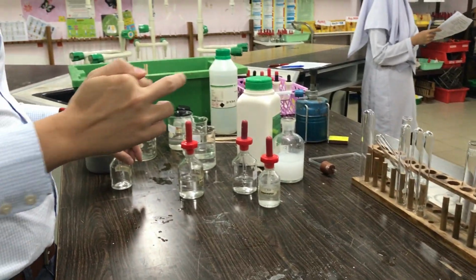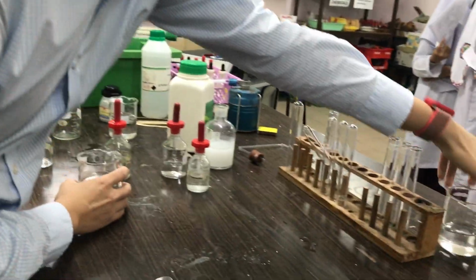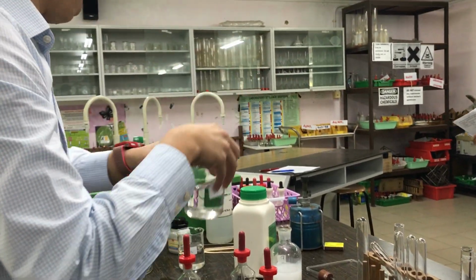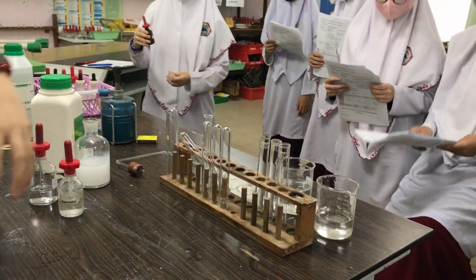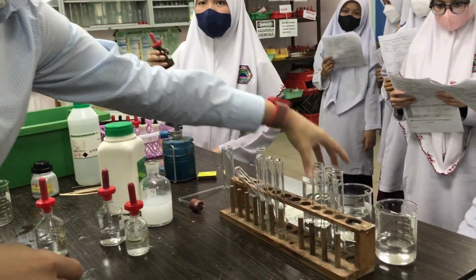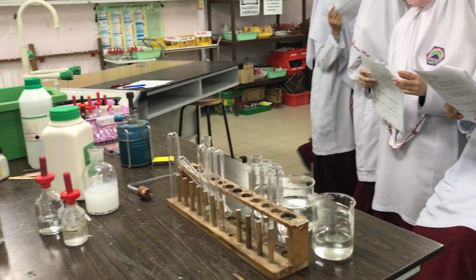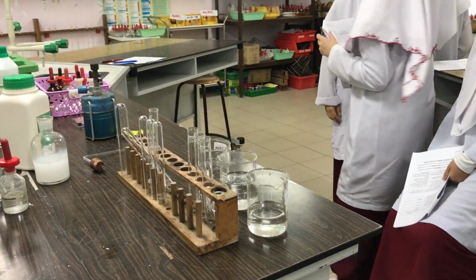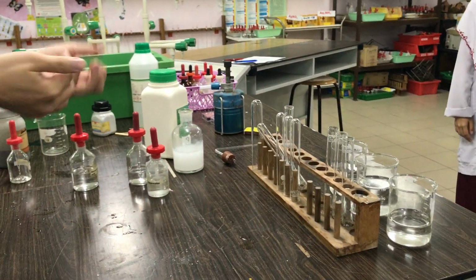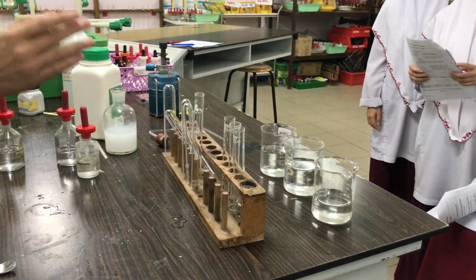Okay, so I've got to add nitric acid to all 3 of them. I have sodium chloride. I have sodium chloride. I have potassium bromide. And I have potassium iodide. Now that's silver nitrate. I need nitric acid. Okay, what color are these solutions? So they are colorless. Are they solution or precipitate? Solution. Because they are all see through, they are solutions.